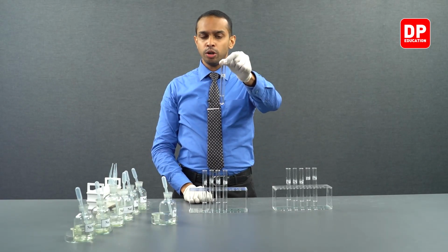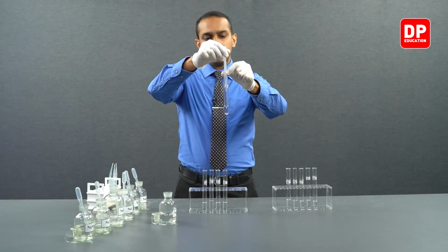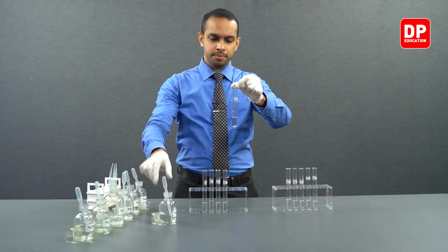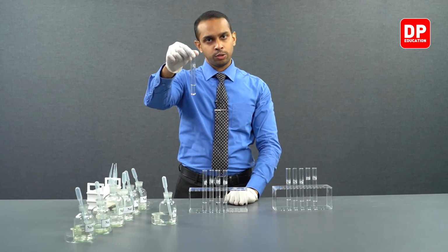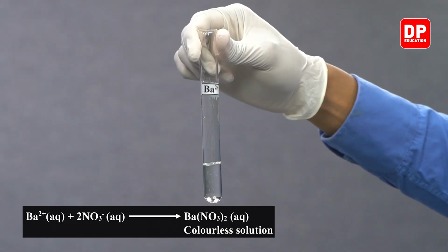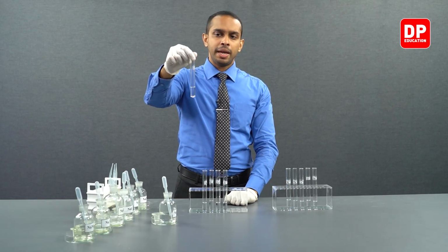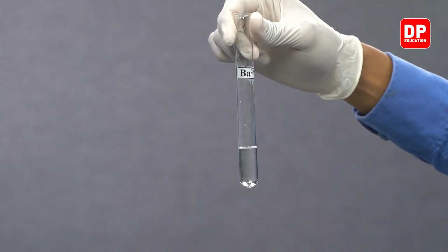Finally, we move on to barium 2 plus aqueous ion solutions. And when I add a small amount of sodium nitrate, you can see we did not form a precipitate here as well. Barium 2 plus ions, when they come into contact with sodium nitrate or nitrate ions, will form barium nitrate. Barium nitrate is soluble in water, so therefore you would not see the formation of a precipitate here.